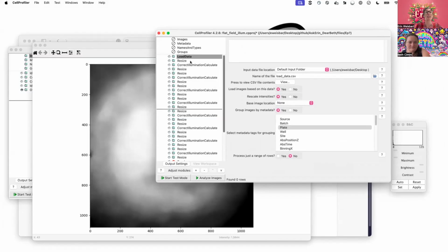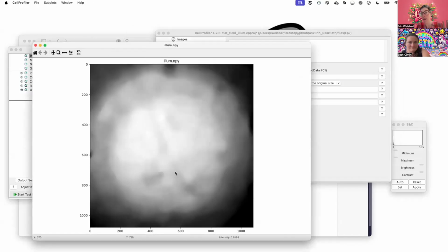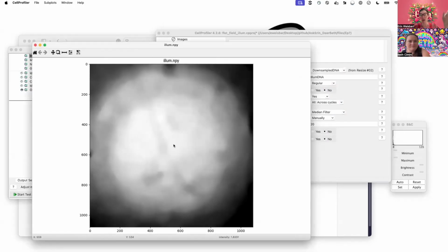What that looks like is here, we have an image, and this is just to make it go faster, and to help fuzz this out. So we generally downscale our image. This is not a particularly large image, it's just an average image off an average microscope here in 2025. We rescale it down to make it smaller. This uses less memory, it goes faster, and it is actually sometimes helpful for getting a smoother illumination.